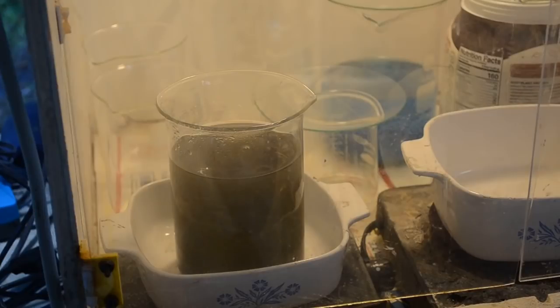So it's getting late in the afternoon. I'll probably leave this sit till tomorrow morning and then deal with it. Tomorrow's Christmas Eve. I might be able to get this cleaned up, dried out, and weighed up before the end of the day. Assuming I don't have too much prep for Christmas going on. And we'll see how much gold I got out of the first half of the first batch, and see if I'm anywhere on target with my prediction. So we'll just let this sit and see what I get.